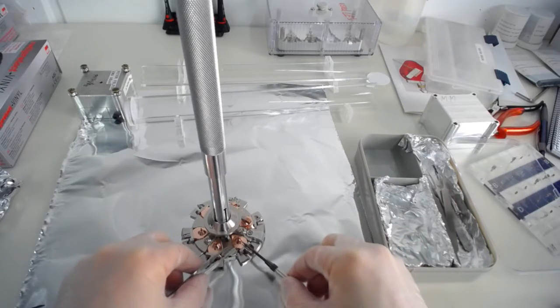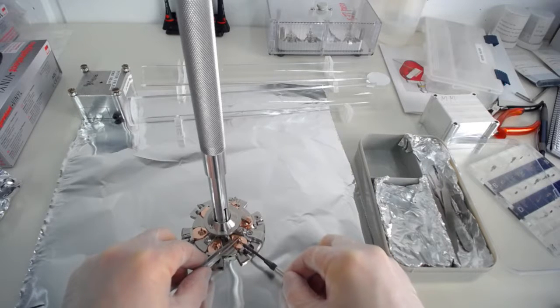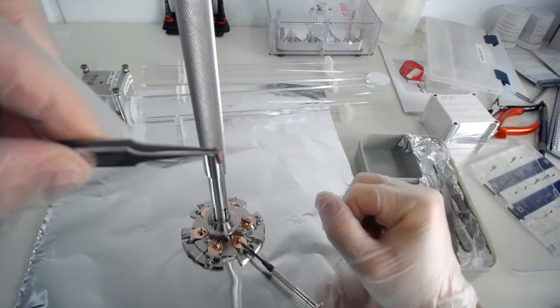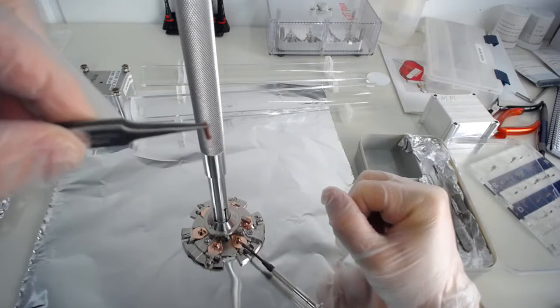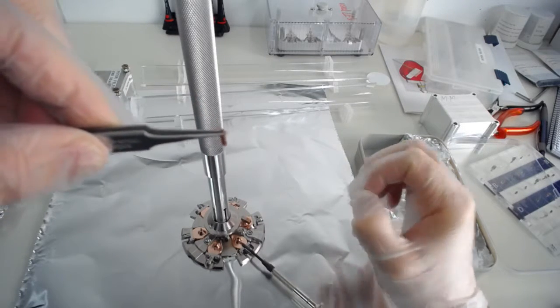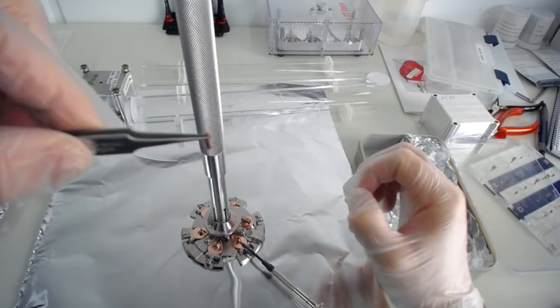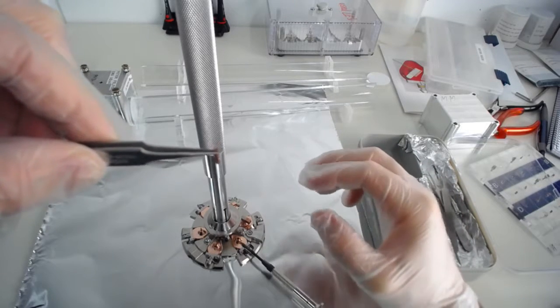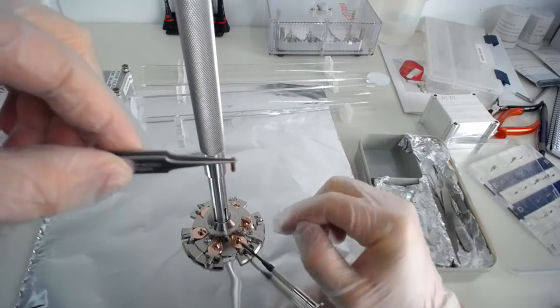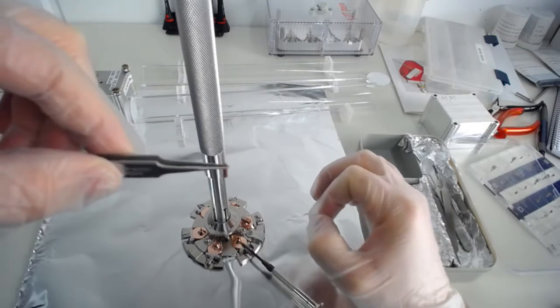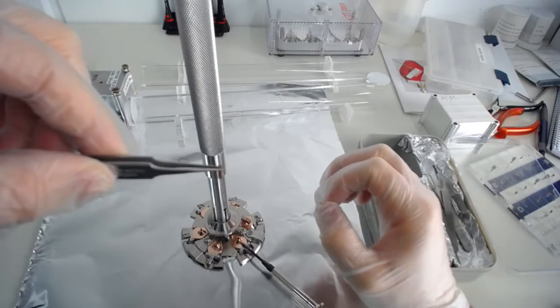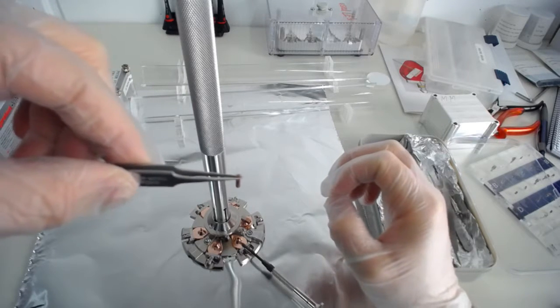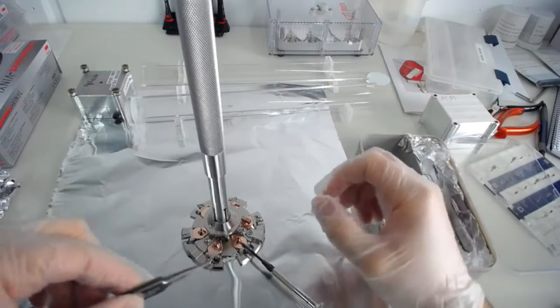While you're moving your sample around, you might actually be tempted to look at your sample, to have a close-up look. When you have a close-up look at your sample, stop breathing. Very important thing. You can have a close-up look at your sample, but while you do that, your breath is actually a source of moisture, like a really bad source of moisture. So if you look at any of the UHV things like the carousel or the samples or anything, close up, hold your breath. If you need to look for an extended period of time, look the other way, breathe out, breathe in, and then look at your sample again. Of course you can breathe in, but you can't breathe out.